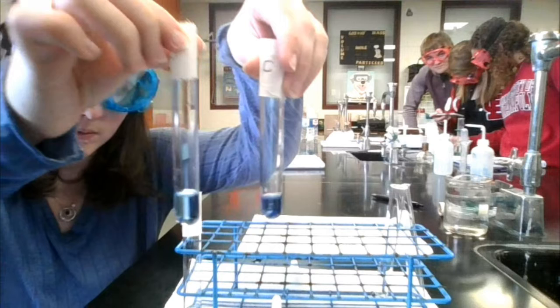Hydrochloric acid is HCl dissolved in water. HCl dissociates completely into hydrogen ions and chloride ions. So adding it, it will shift the reaction towards the right, being the side of the cobalt tetrachloride ion. So that's why you see the bluer color here.